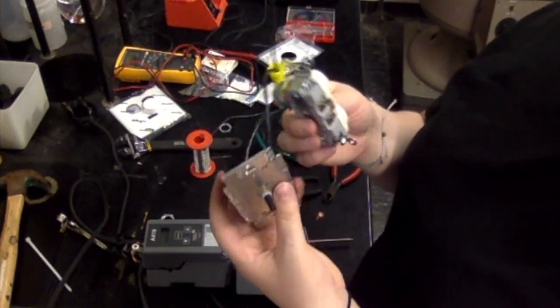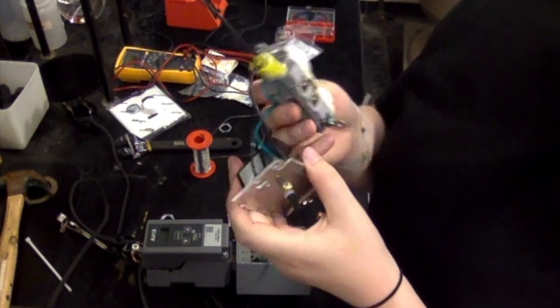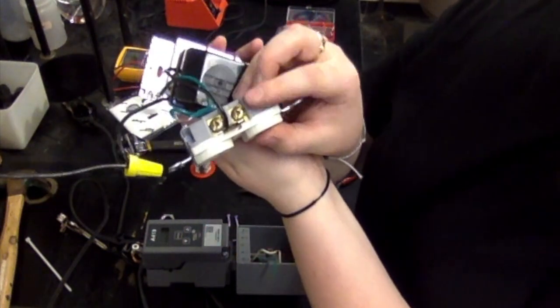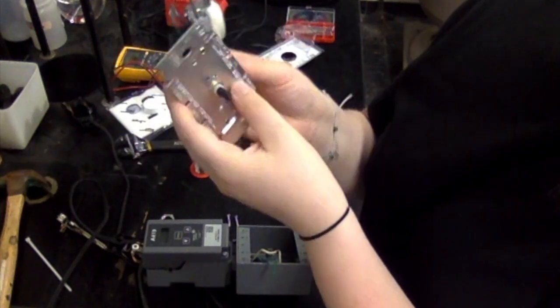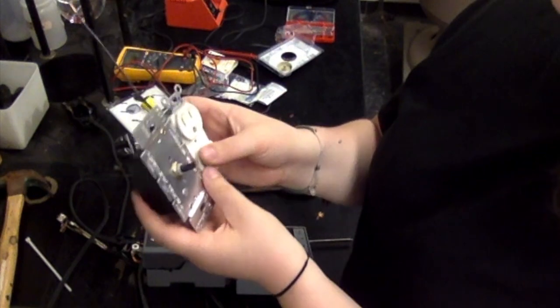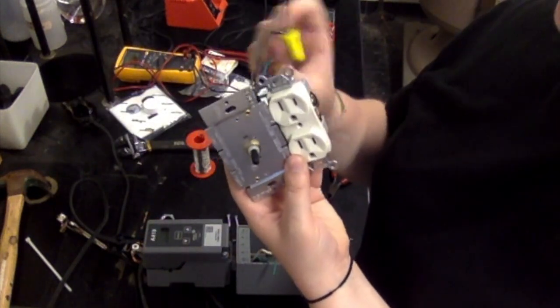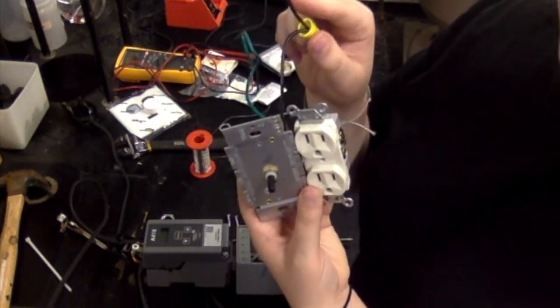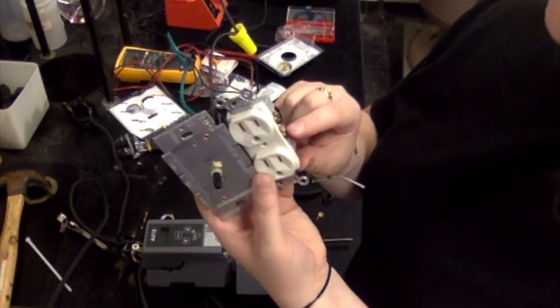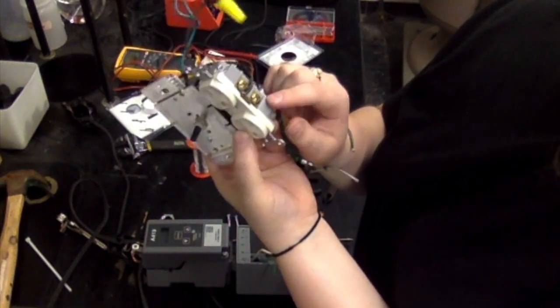And you're going to make the connection from the other black wire, the one that doesn't have your extension on it, to the brass side of the 2-gang outlet. It should be configured like this. As of now, the green doesn't have anything connected to it. One of the blacks has an extension with the screw nut, and the other black is connected to the brass side of the 2-gang outlet.